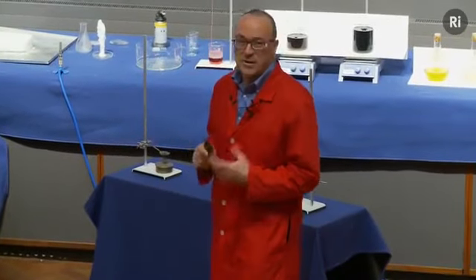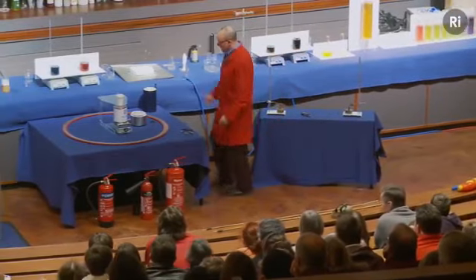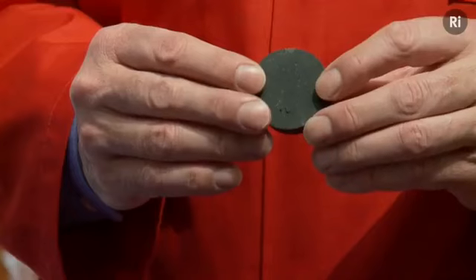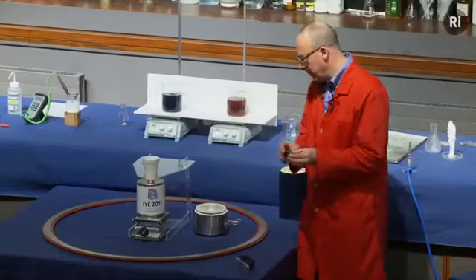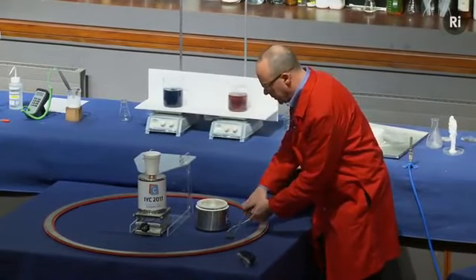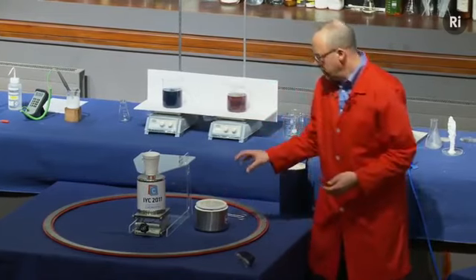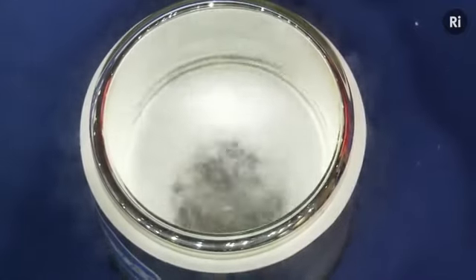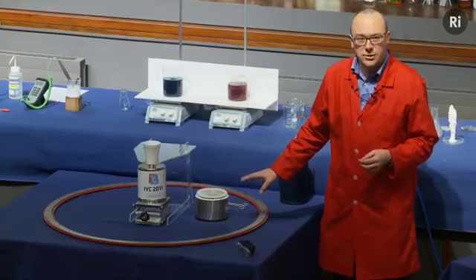We're going to look at the first of these, yttrium. Now, yttrium can be used to make a compound, and I have some of the compound here. It's called yttrium barium copper oxide, and it's just a hard black lump of ceramic material. What I'm going to do is to put it into some liquid nitrogen, and so that yttrium barium copper oxide is now being cooled down to minus 196 degrees. That takes a moment or two to cool down.